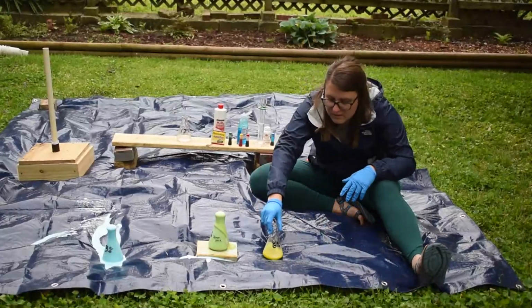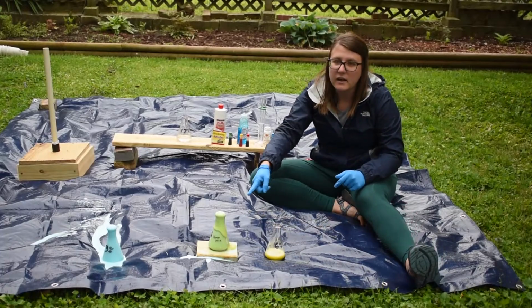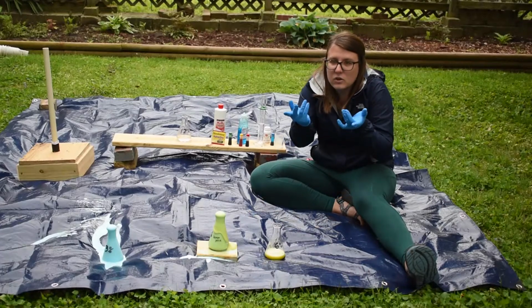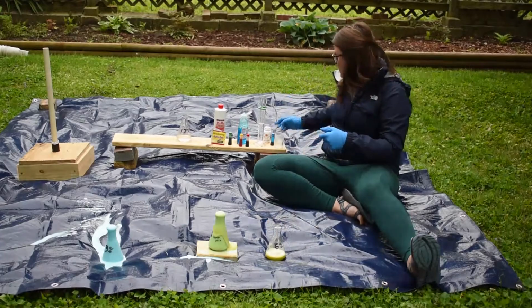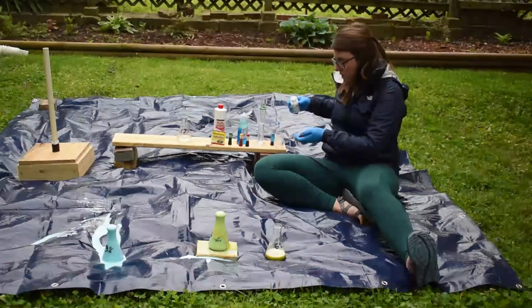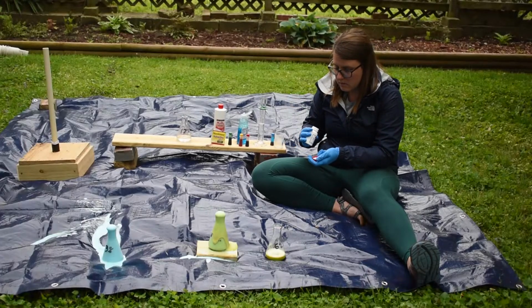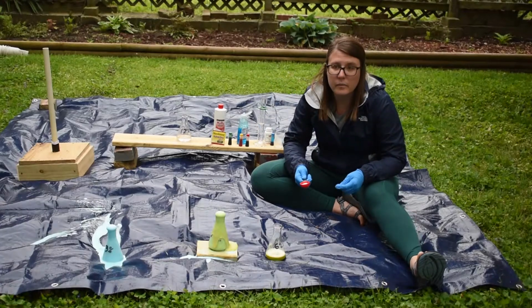And let's do this one right next to it. So we'll be able to see those two reactions side by side. You can see this one's still happening pretty slowly. It's like slowly oozing out. Hopefully, since this one's twice as concentrated, we'll be able to get that to happen a little bit more quickly. Okay. So here we go.